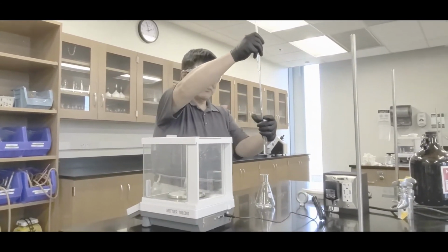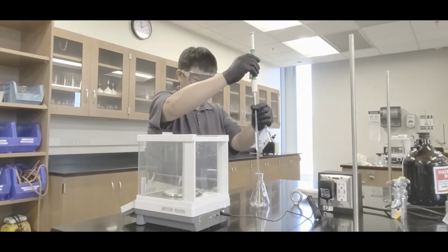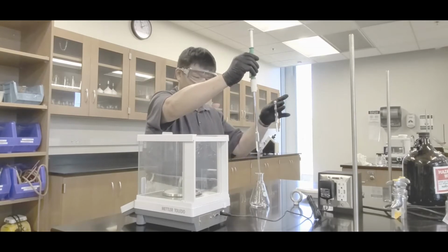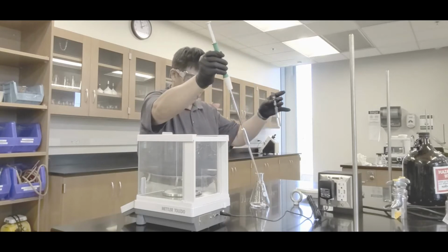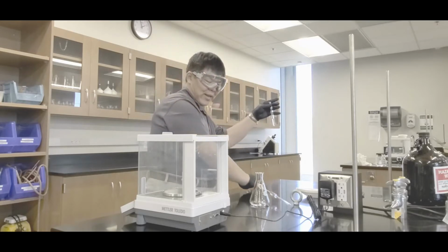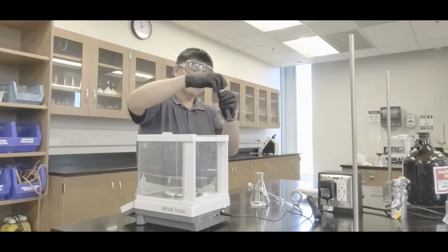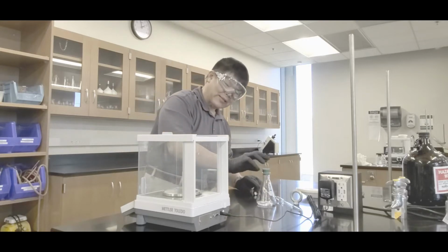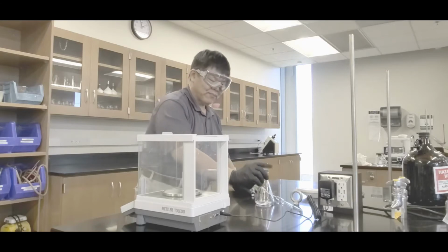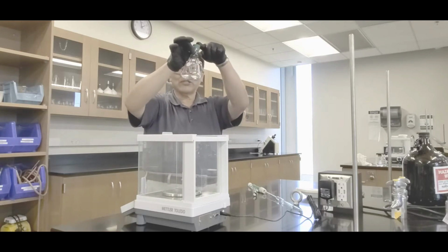Then what you do is go and open up the flask, take the stopper off. Then put it into the flask, push the button, and it'll dispense. Hold both, okay? And of course the last bit is also touch the pipette to the flask, so that we get all the liquid out. Put that down. Close your sample. Put the stopper back onto the flask. Okay? Got it? So put the stopper back on the flask. Now you've got a flask with the liquid in it with a stopper.